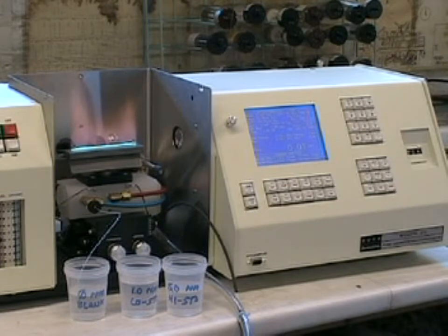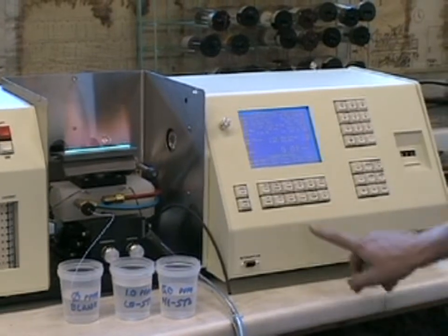If you're doing many samples, in excess of 8 or 10, you can automatically recalibrate from the active analysis screen by using the Auto Zero and Reslope functions. To do this, while aspirating the blank, press the Auto Zero key.